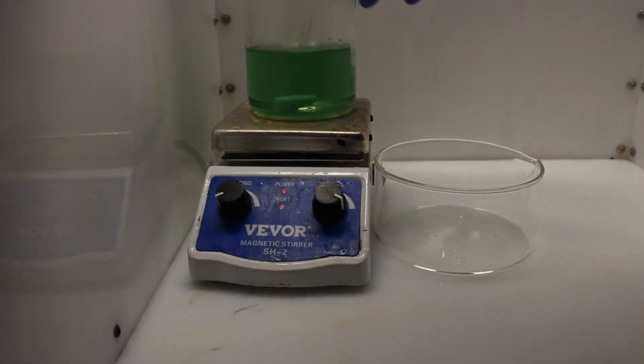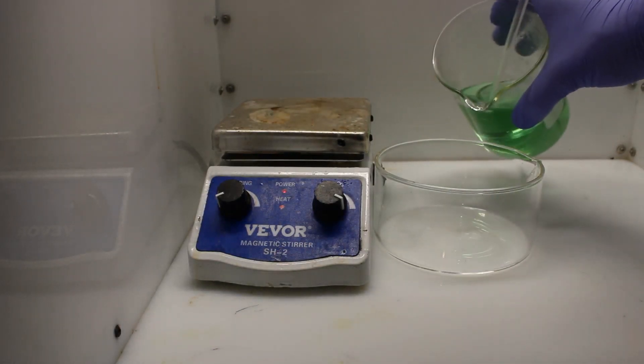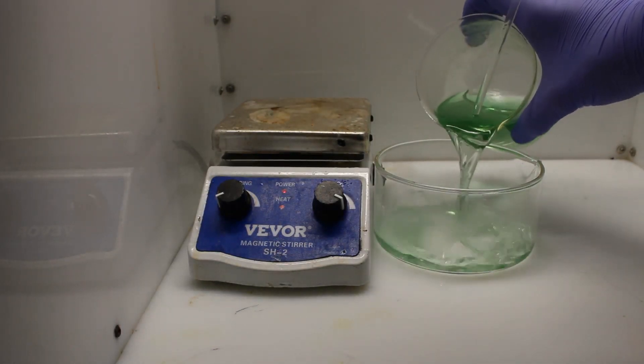The solution is then transferred to a dish and allowed to cool to room temperature. Over the course of around an hour, crystals of the product form.